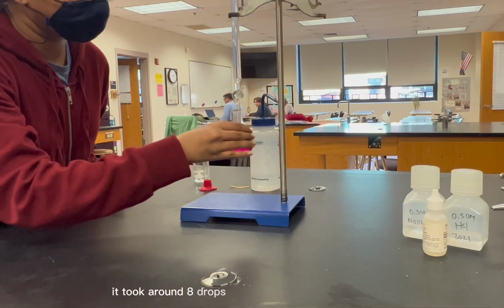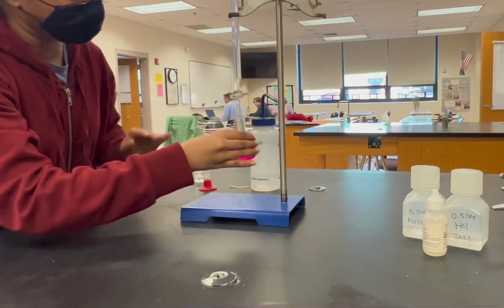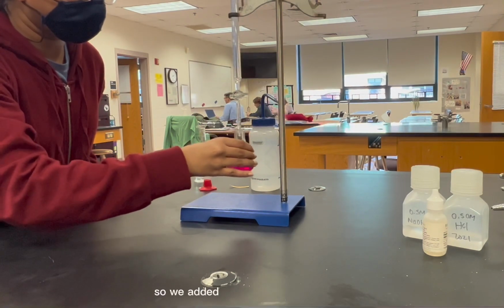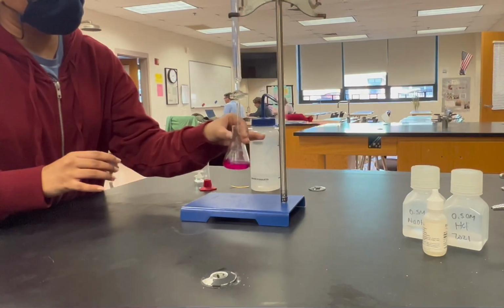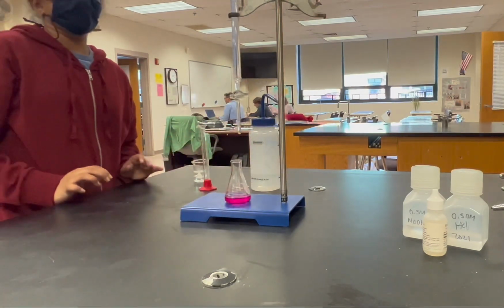It took around 8 drops of NaOH to neutralize the Sprite solution. Unfortunately, the solution in the video was over-titrated, so we added too many drops of NaOH, but usually it takes around 8 drops to neutralize Sprite.